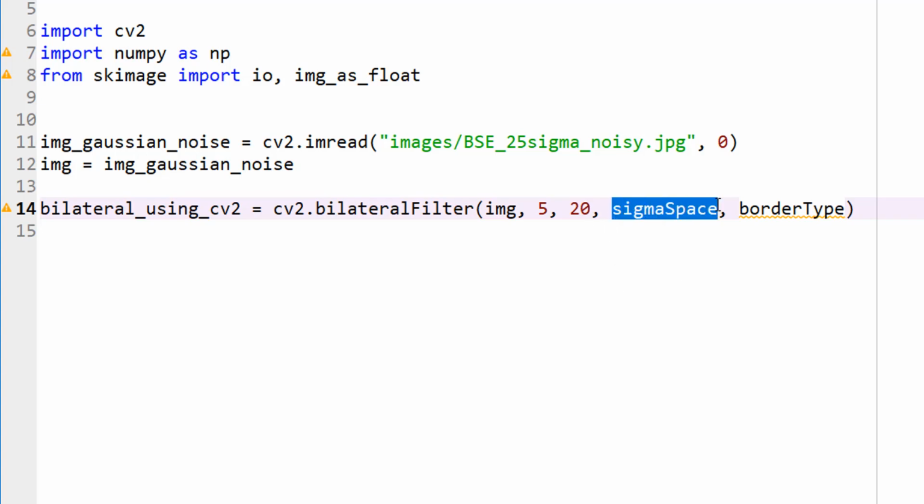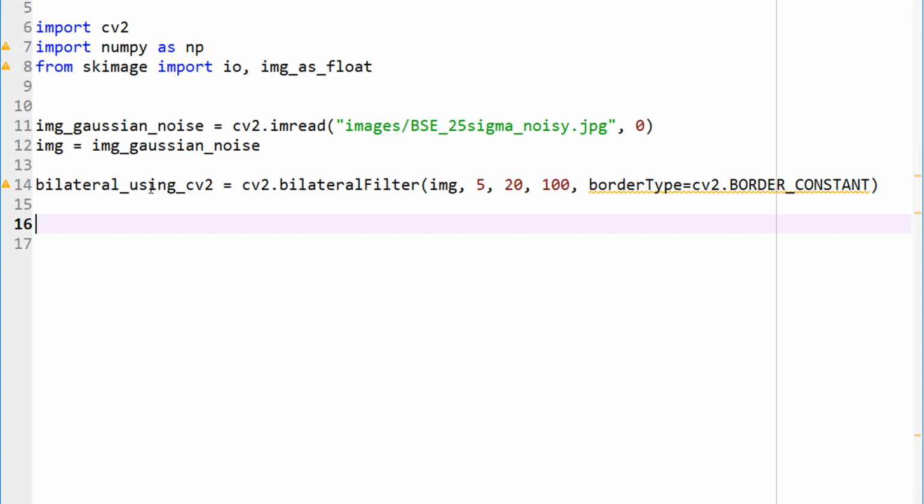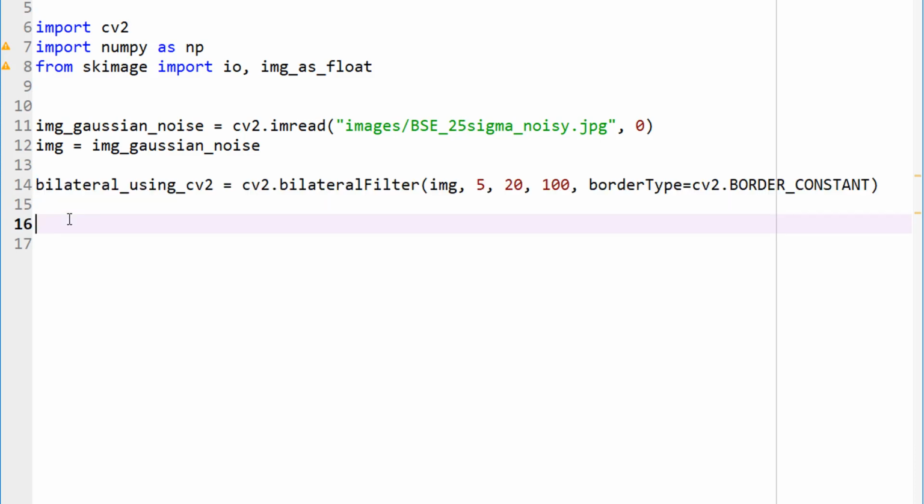Sigma space, I don't know, we can just go ahead and start with a value of 100. Again, at this point, I have no clue what works. You just need to experiment. Now, border type, I covered this previously in my last 2 or 3 tutorials, and this is how you would like to deal with your border pixels. So I'm going to add a constant border. Let's go ahead and run this just to make sure everything works. Okay, that's fine, so no issues.